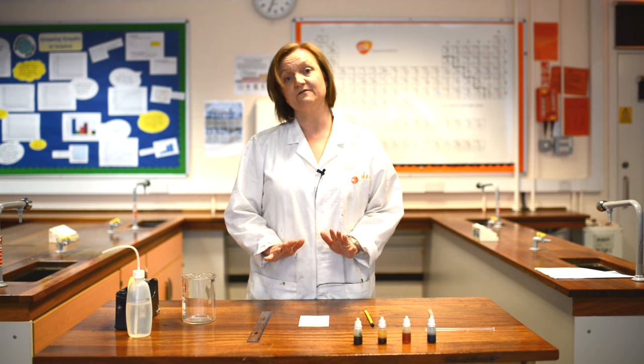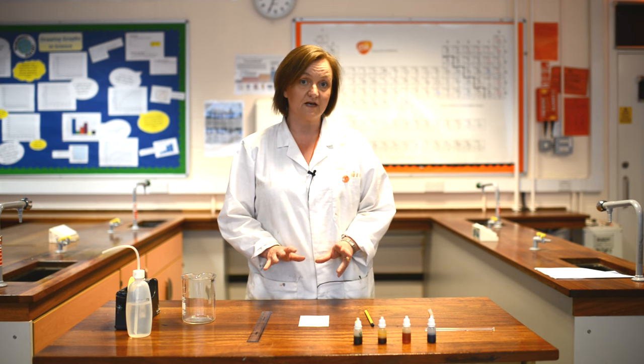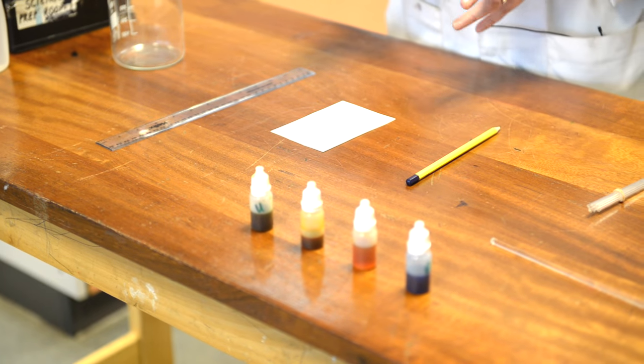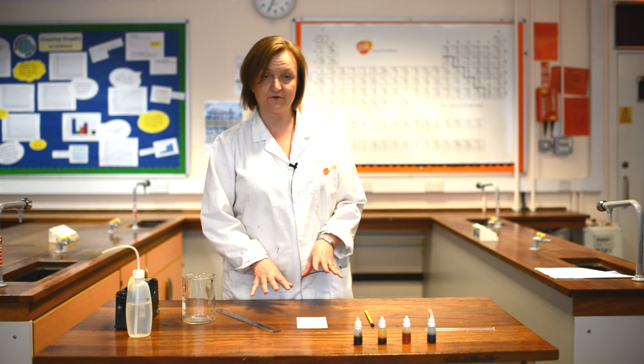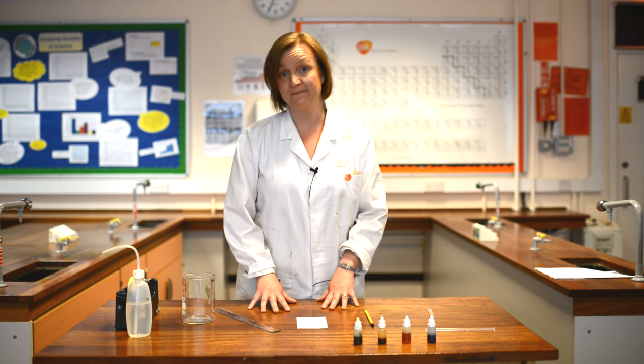So we're going to look at chromatography to separate different colored materials in food coloring. We're going to start by setting up our stationary phase, which for our chromatography today is going to be paper.